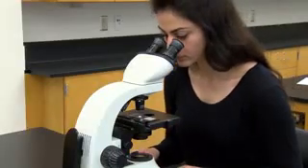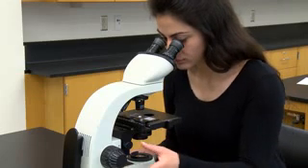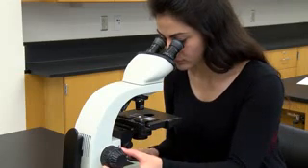Start with the low-power objective lens, 4x, and the stage in its highest position. Then look through the ocular lens and focus on the specimen, which should already be nearly in focus. Once you have found the specimen on low power, be sure it is centered in the field of view.